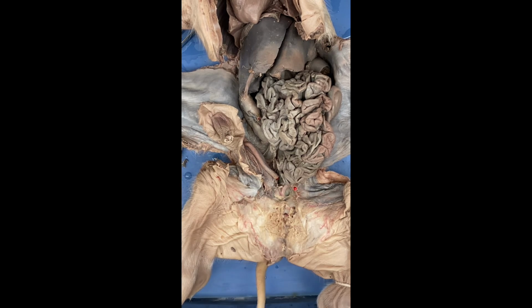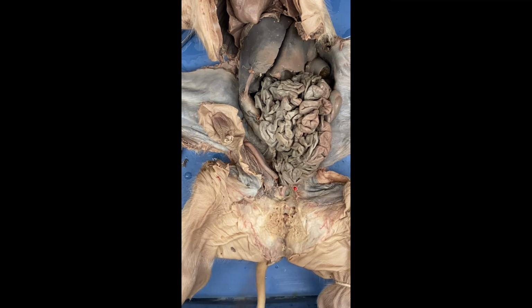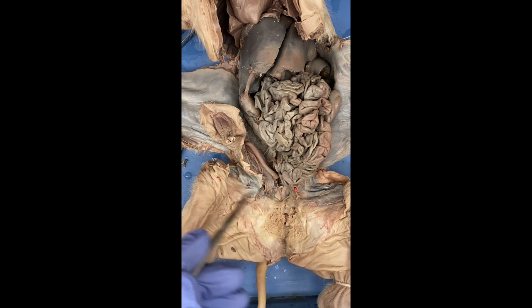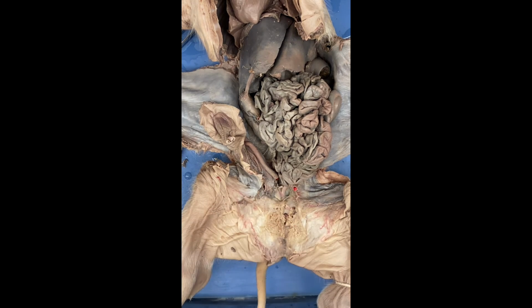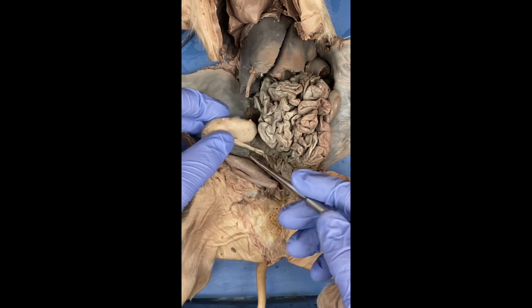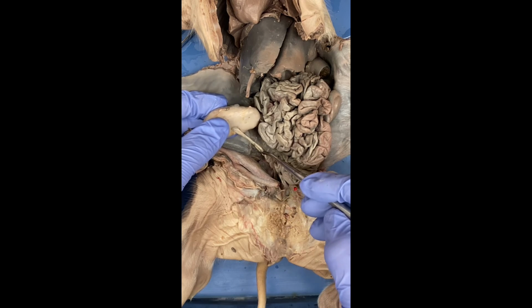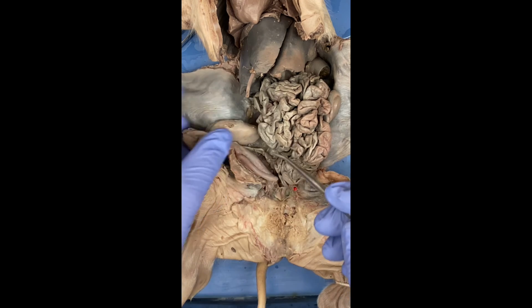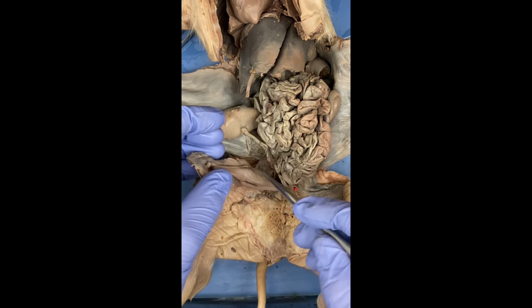So next we have the urethra, which is pretty difficult to find. The urethra is going to be in this area. It's after the urinary bladder. There's two tubes. One is the vagina, and one is the urethra. And it leads from the bladder to the outside. The ureter is next, which is going to be the tube that connects the kidney. So here's the ureter. This is a very nicely exposed one. The ureter goes from the kidney to the urinary bladder.